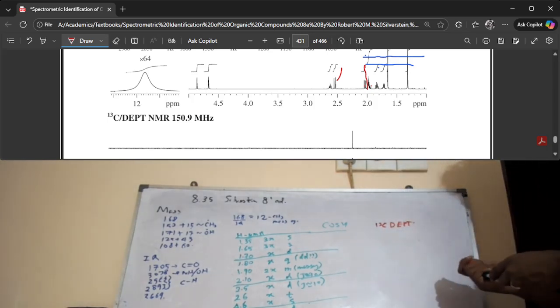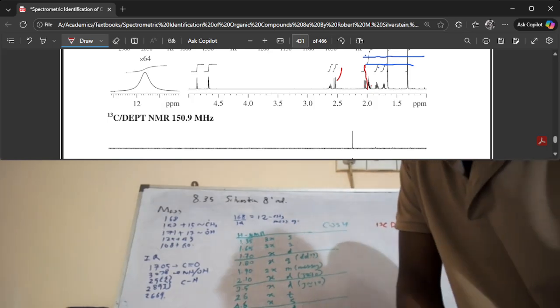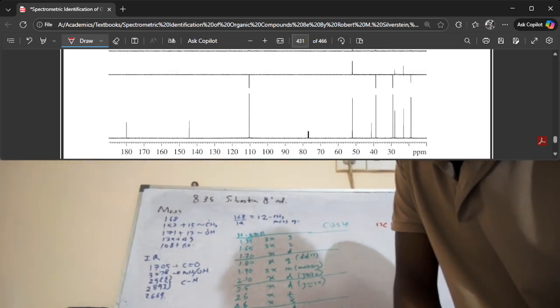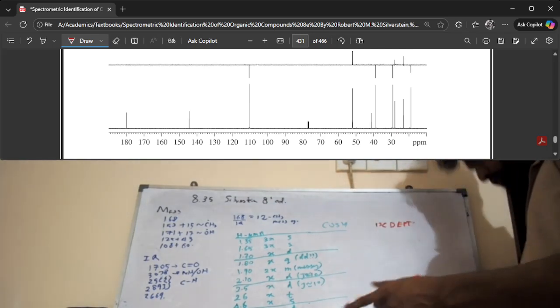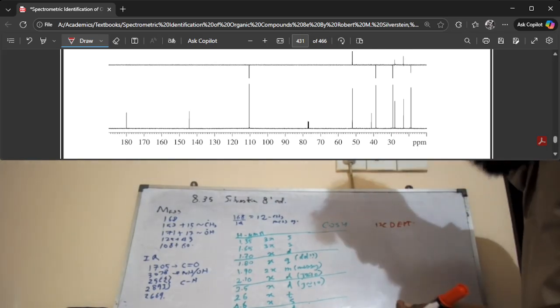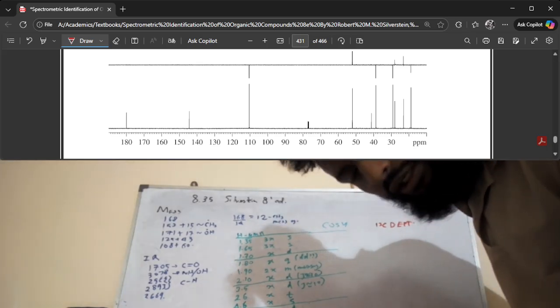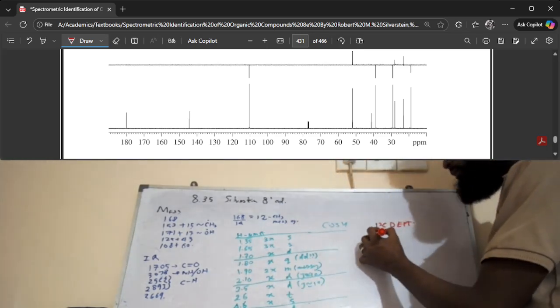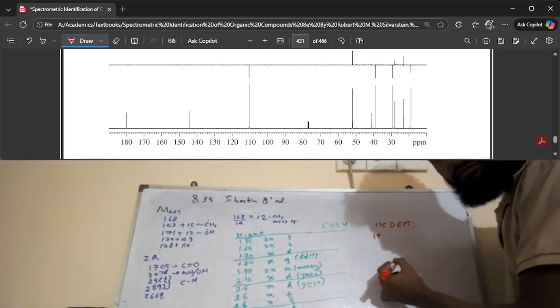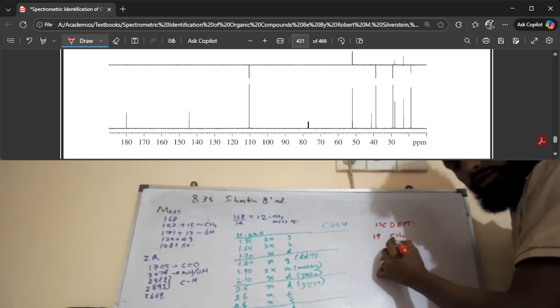Okay, that's usually where you see a broad peak, this far downfield. That's probably a carboxylic peak. So we have the C13 DEPT here. For that one, we look at the table. You can see the first one is at about 19. The height of the peak gives us no useful information. The DEPT clearly tells us it's a CH2.